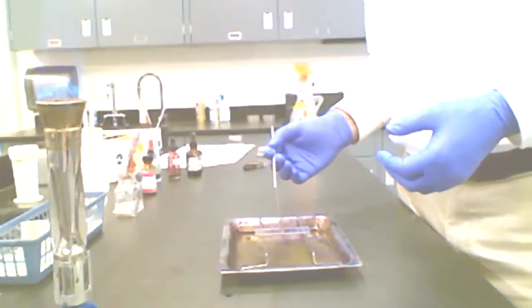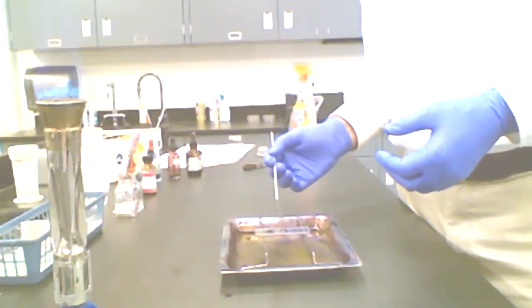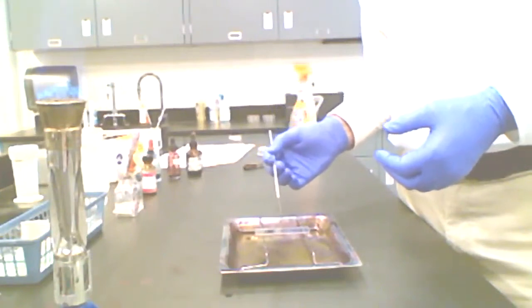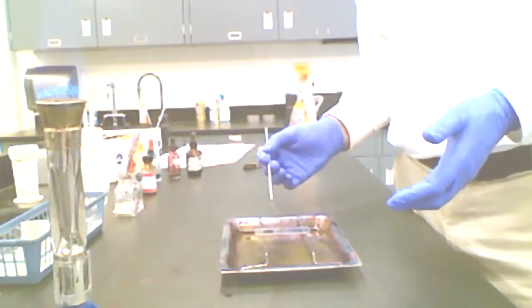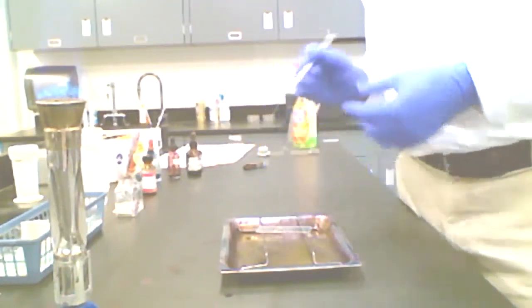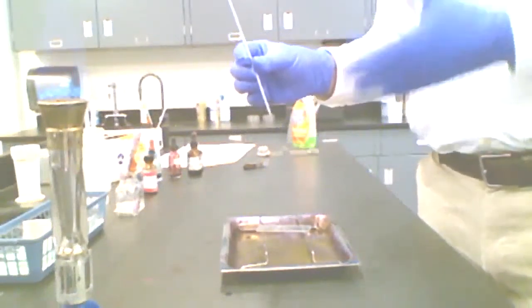And I'm now going to just go ahead and put that in my drop. And I'm going to spread this out into an area about the size of, say, a nickel. This is emulsification. I'm making an emulsion of bacteria and water. I spread that out to make a nice thin smear so that it will dry fairly rapidly. Now, I want to go ahead and air dry this, what we call a smear.